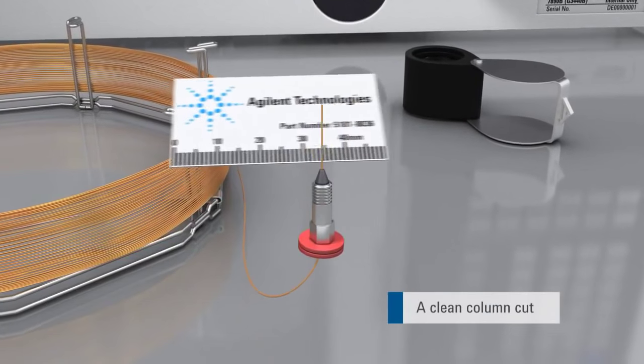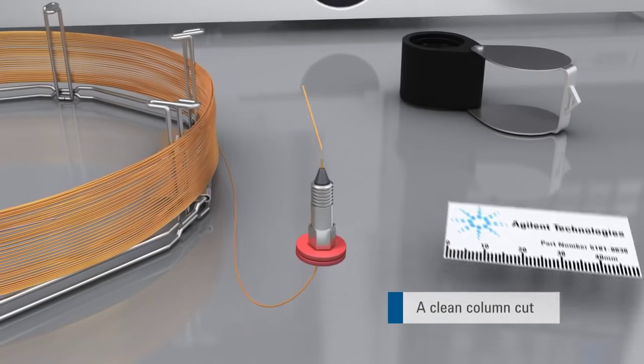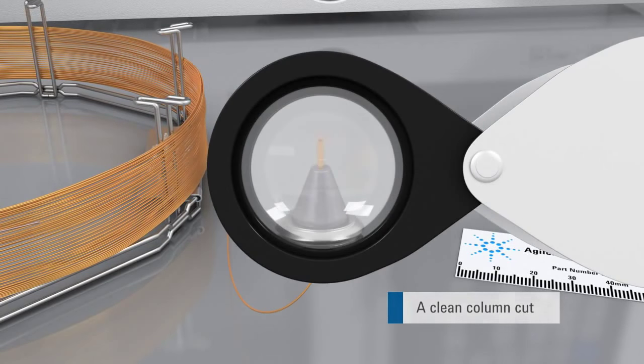Make a fresh cut. Visually inspect that the end is free of chips, burrs or uneven areas.